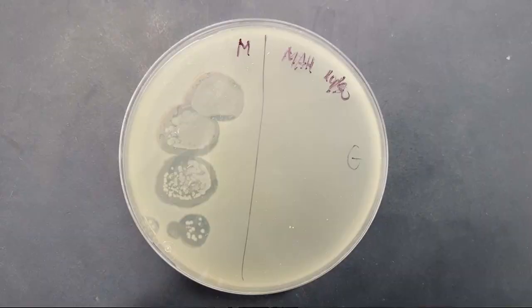Keep in mind that up to this point, we have no idea if we even have phage. We're praying and hoping that that sample actually has phage in it and yielded a positive result, which we'll see after the two days are up. That's why I wasn't exactly working with just one soil sample. In fact, it would take me eight samples to get a phage. And voila! Our plate is positive. You see that little speck right there? Well, that basically says that there's actually dead bacteria, because the bacteria would grow consistently flat on the plate, but where it's missing, there's a virus killing it. So that means that we have phage there.